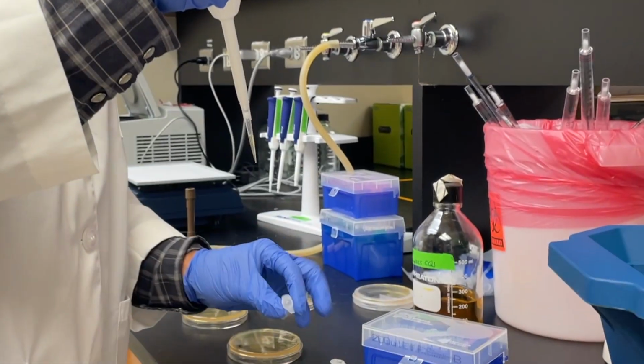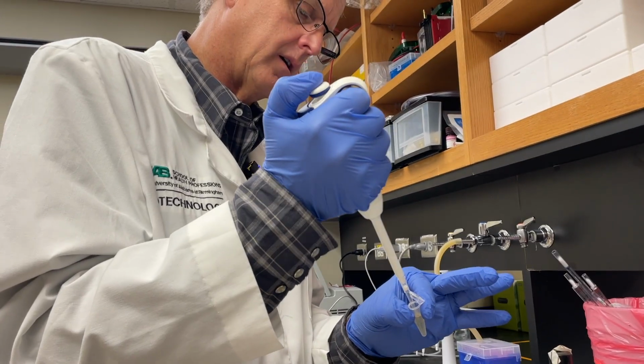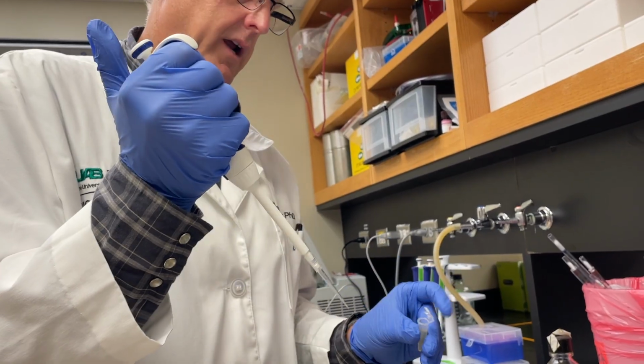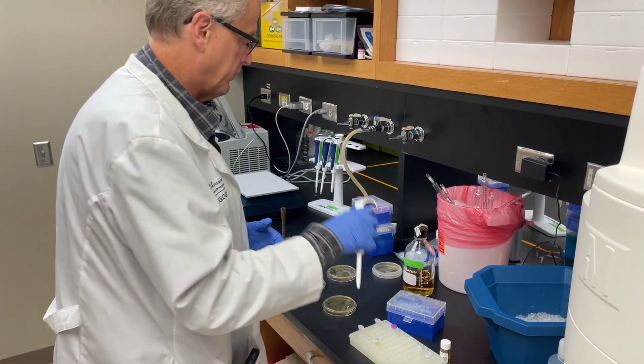Mix it up just a little bit. I'm just going to mix it up, mix it up, mix it up. All right, now we're ready to go. We set this to 50 microliters, and you'll see what I'm going to do right now.